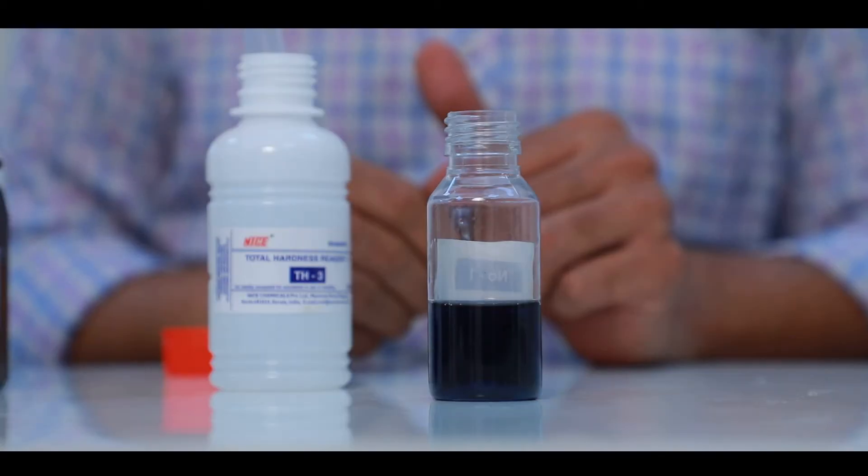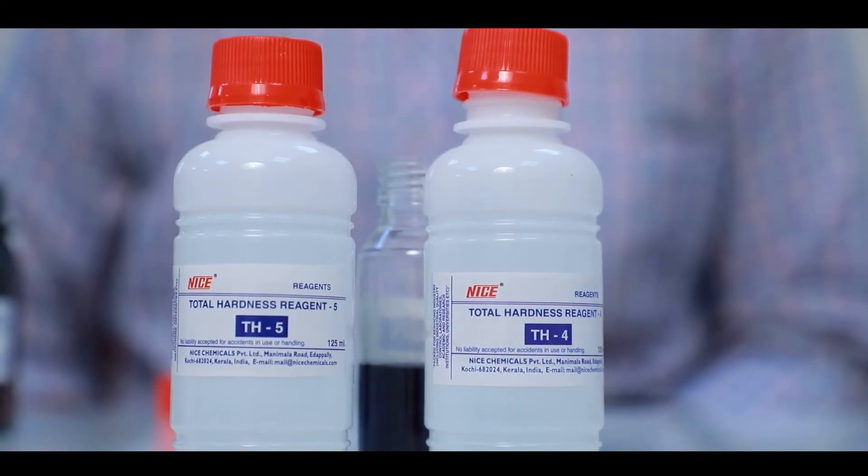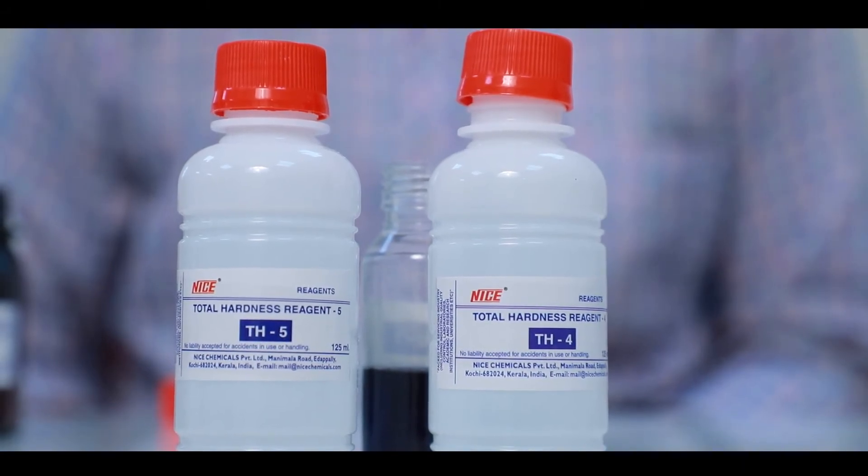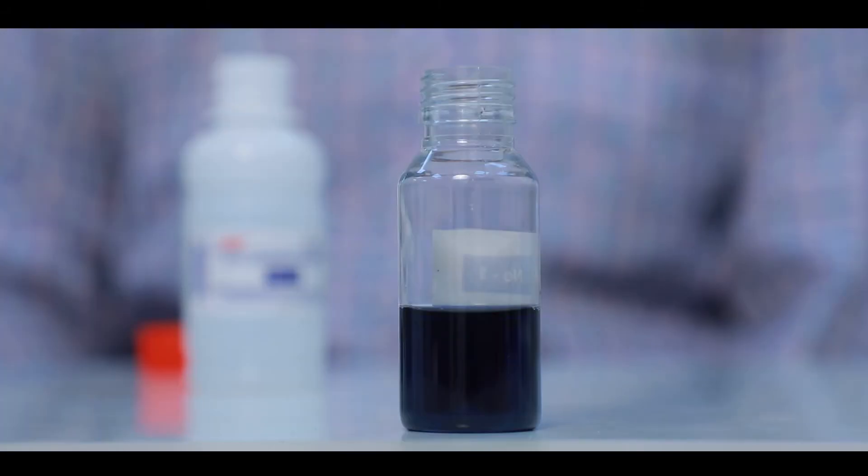For soft water we can use Total Hardness Reagent 4. In this case Total Hardness is equal to number of drops into 2.